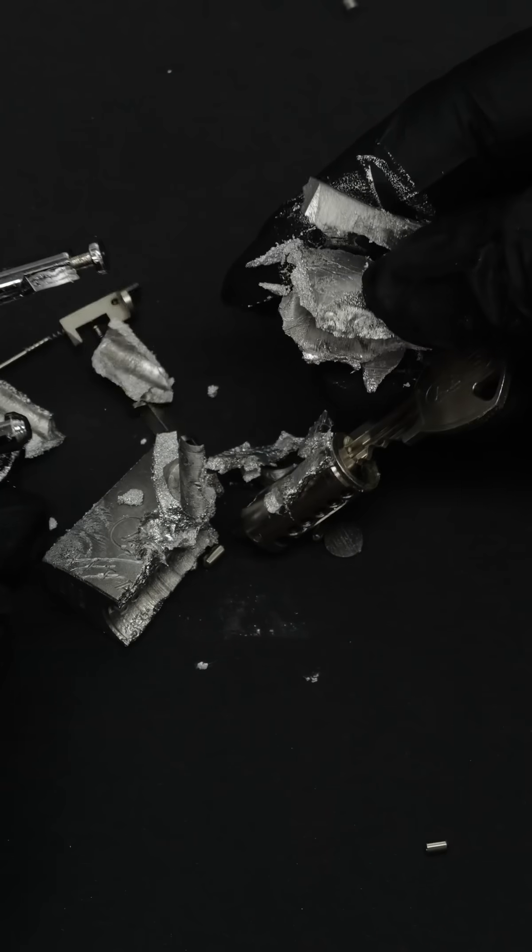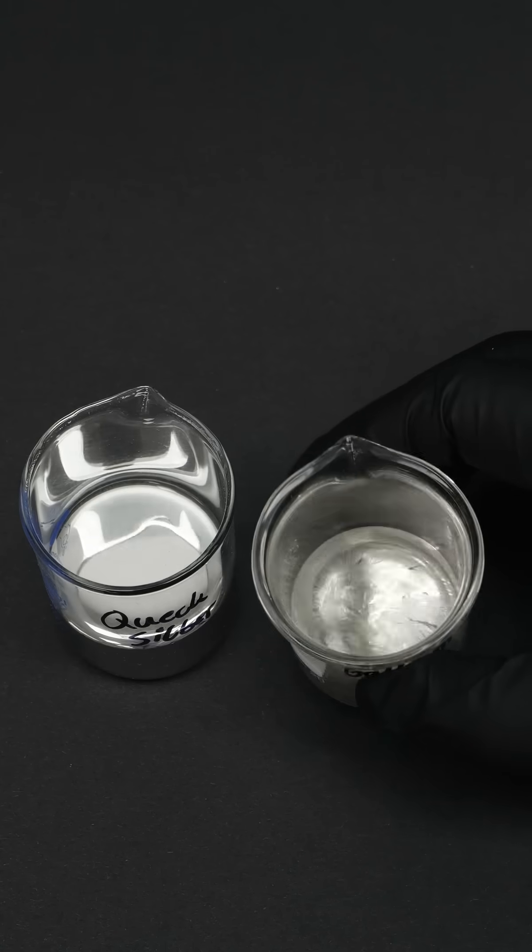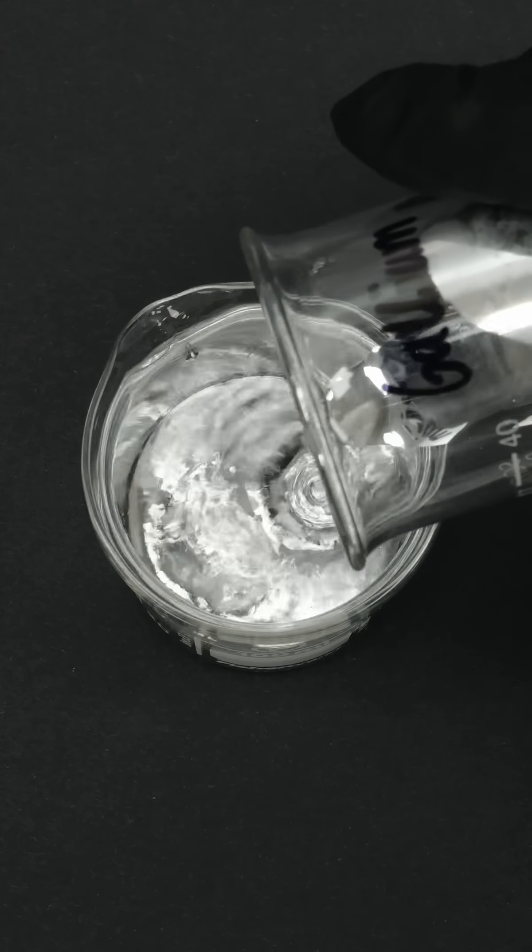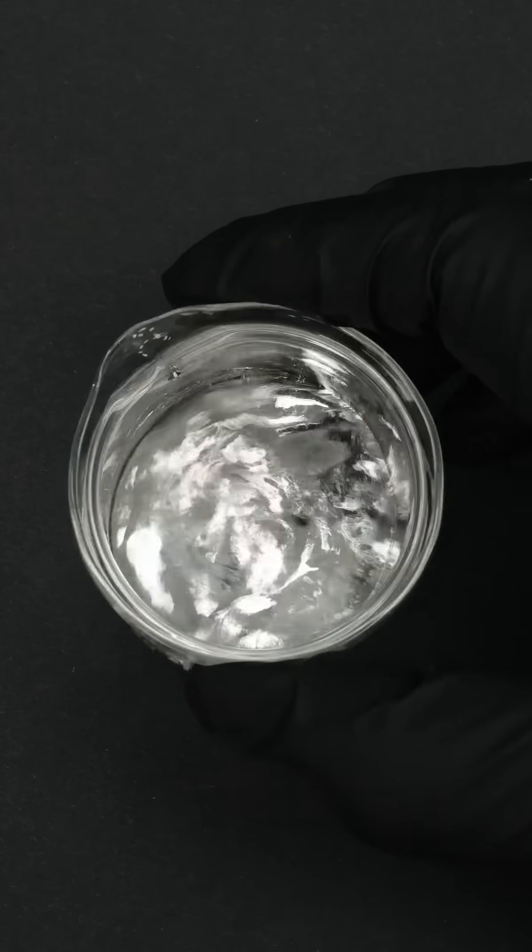Now I'm genuinely quite curious about what happens when I mix these two metals, which eagerly form compounds with other metals together. Using a quick and simple approach, I pour the gallium into the mercury, mix the two, and transfer the liquid metal into a glass container.